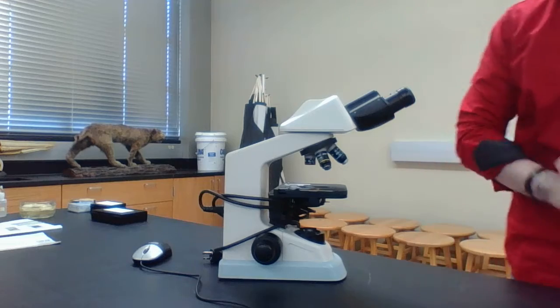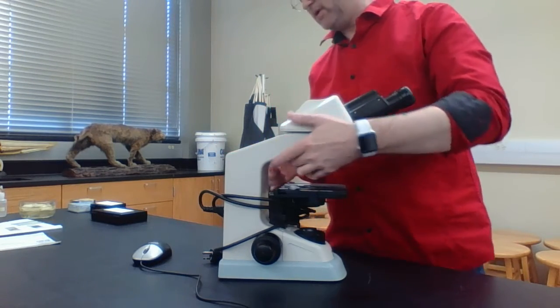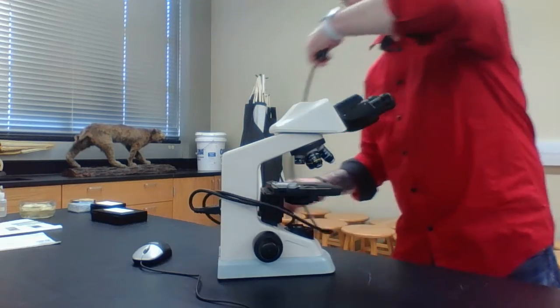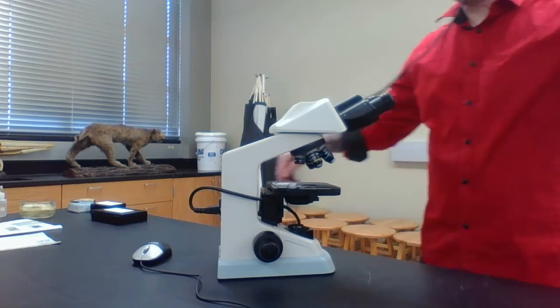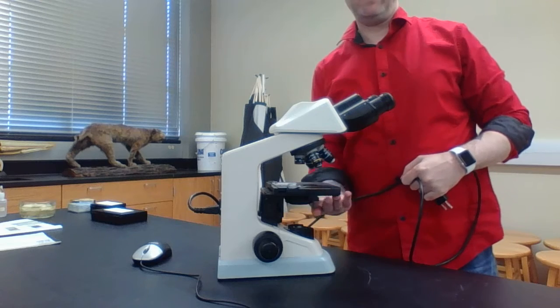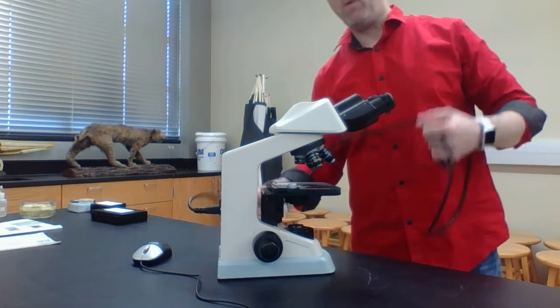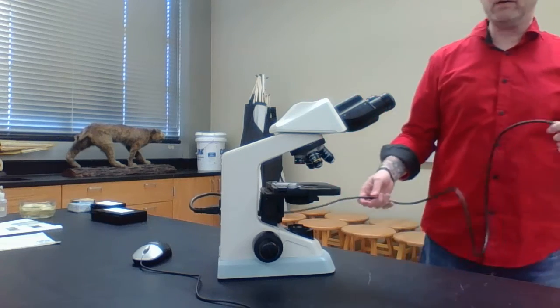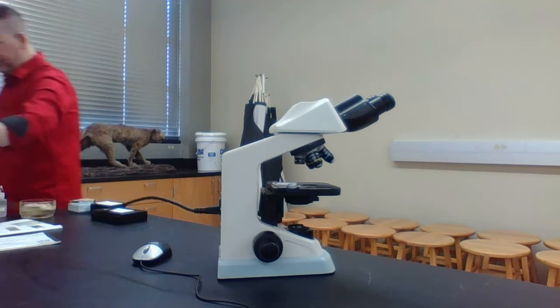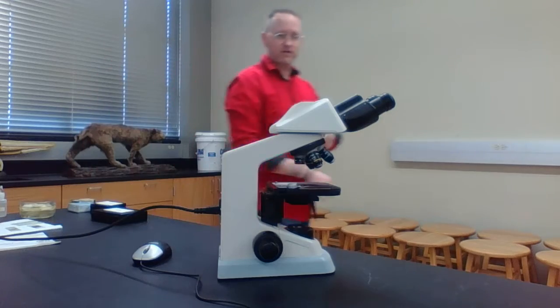So next thing we want to do is talk about the parts of the microscope. Notice again, we do have to plug this in. Usually the electrical cord or the power cord is normally wrapped around the microscope. And notice it's wrapped around this structure right here, which is called the stage. I'll talk about why we actually do it. Take it out, and if you want to, you can actually plug it in. I guess I can plug mine in. So I've actually plugged it in.